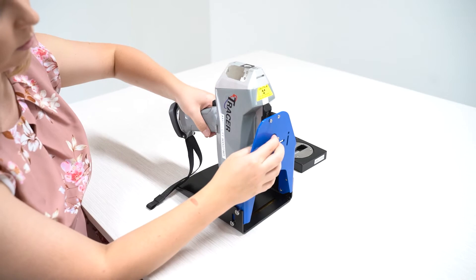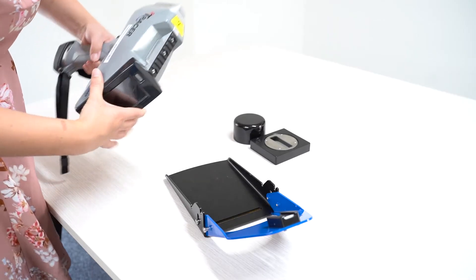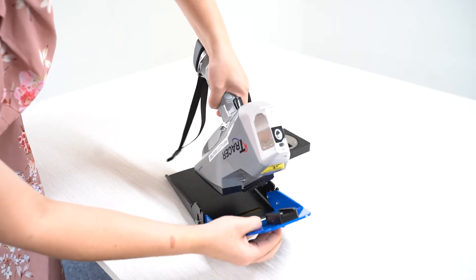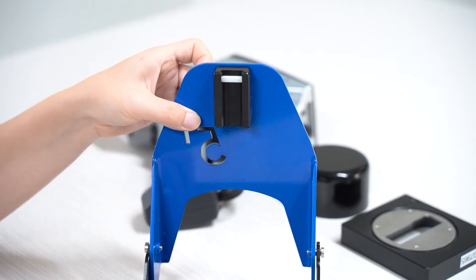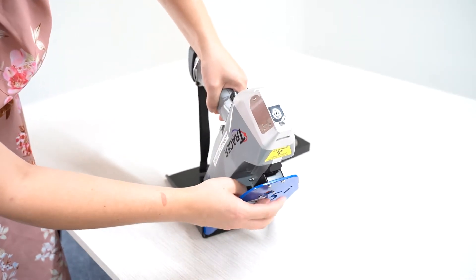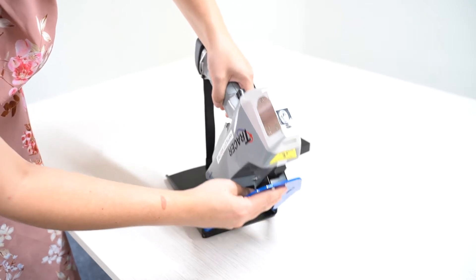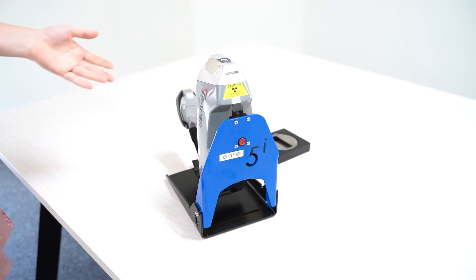It's time to look into how to analyse with the window facing upwards. Start with the stand at a 45 degree angle, and click the button to release the rail mechanism. Slide the tracer upwards and release the button when you're ready to lock it in. In an up and over movement, place the tracer at a 90 degree angle in the stand, ready for analysis.